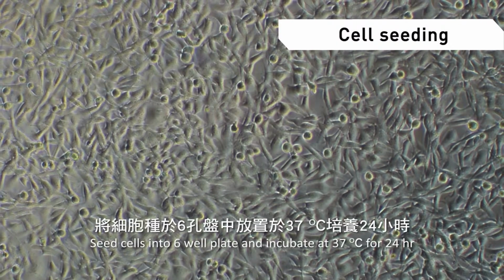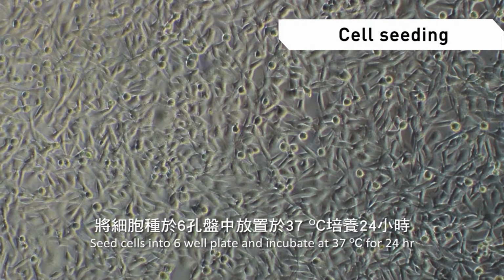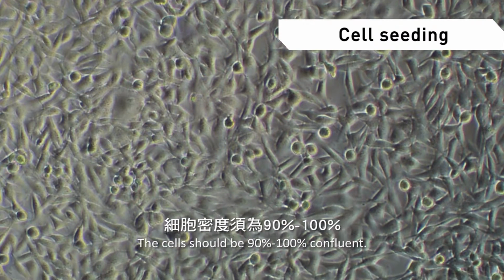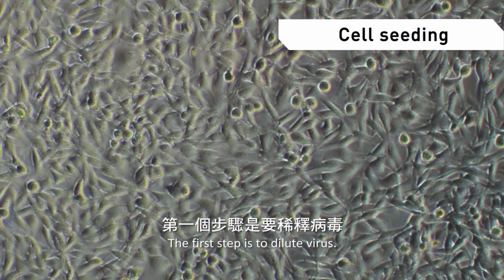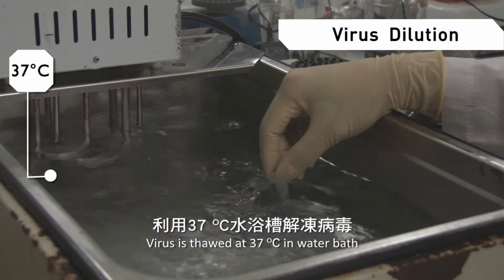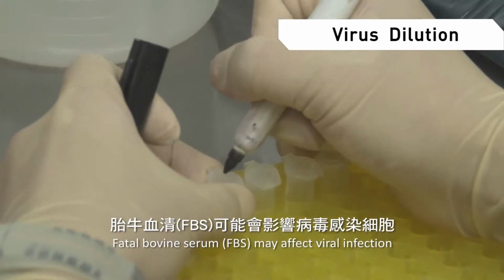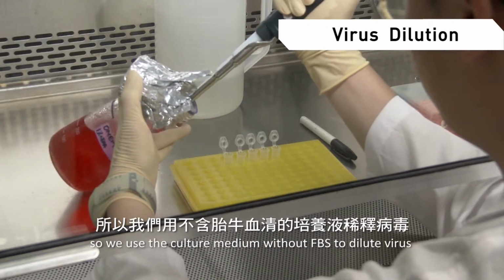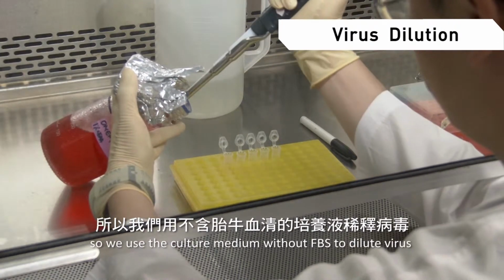Seed cells into a 6-well plate and incubate at 37 degrees Celsius for 24 hours. The cells should be 90% to 100% confluent. The first step is to dilute the virus. The virus is thawed at 37 degrees Celsius in a water bath. Fetal bovine serum, FBS, may affect viral infection, so we use culture medium without FBS to dilute the virus.